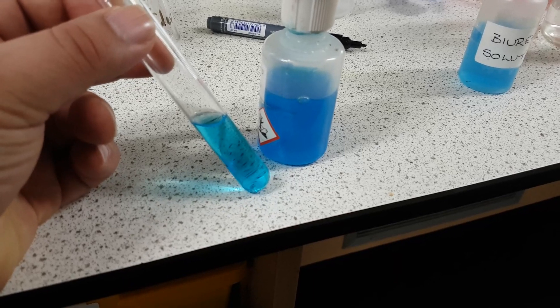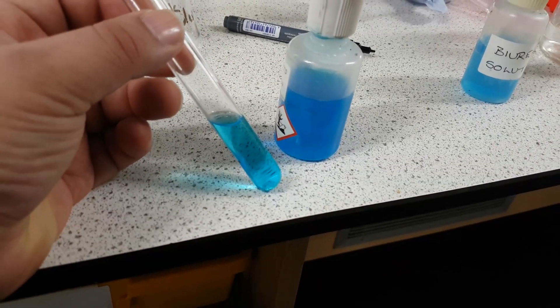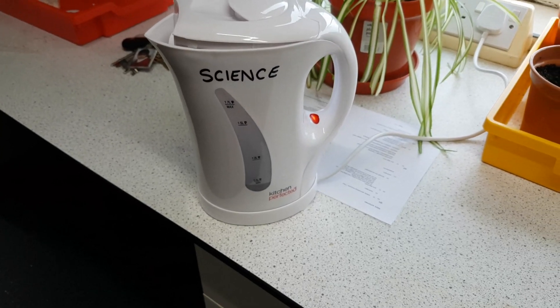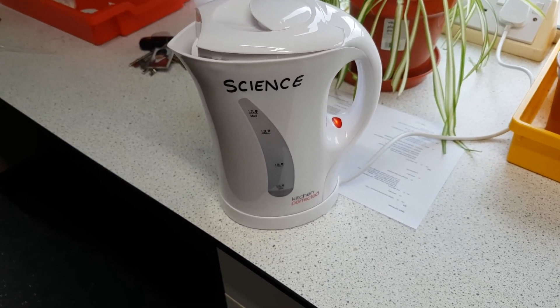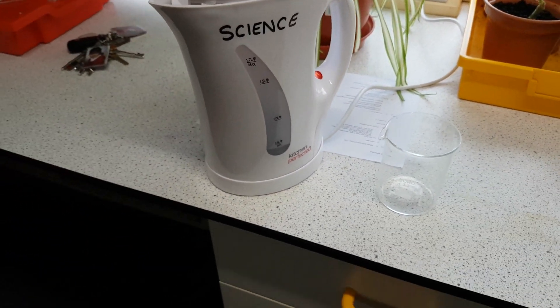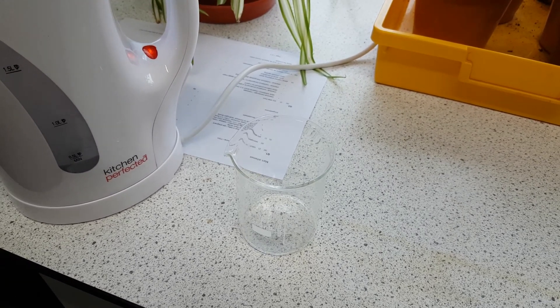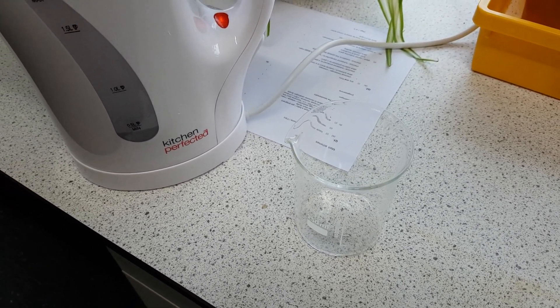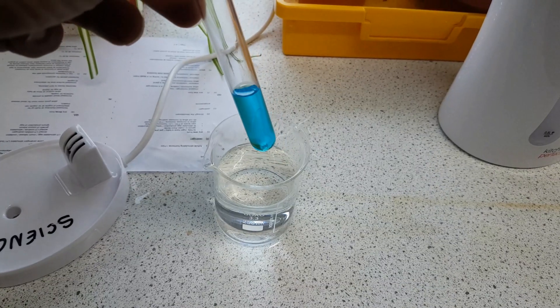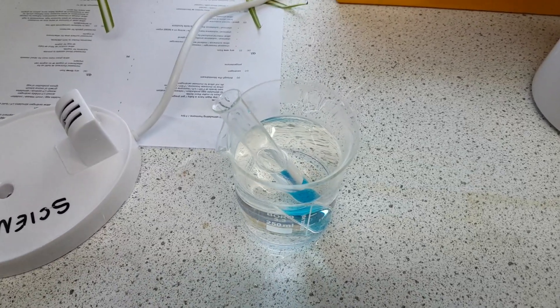There is a negative Benedict's solution test — it is blue. What I should do with this one is put it in some hot water because that's exactly what we're going to do. I'm going to show you a negative result when putting it in hot water. I've put some water in a kettle, let it come to a boil, then placed that boiling water into a large 250 ml beaker, and I'm going to place our negative test into the beaker. That's exactly how we test for sugars. It has no sugar so we shouldn't expect a color change.